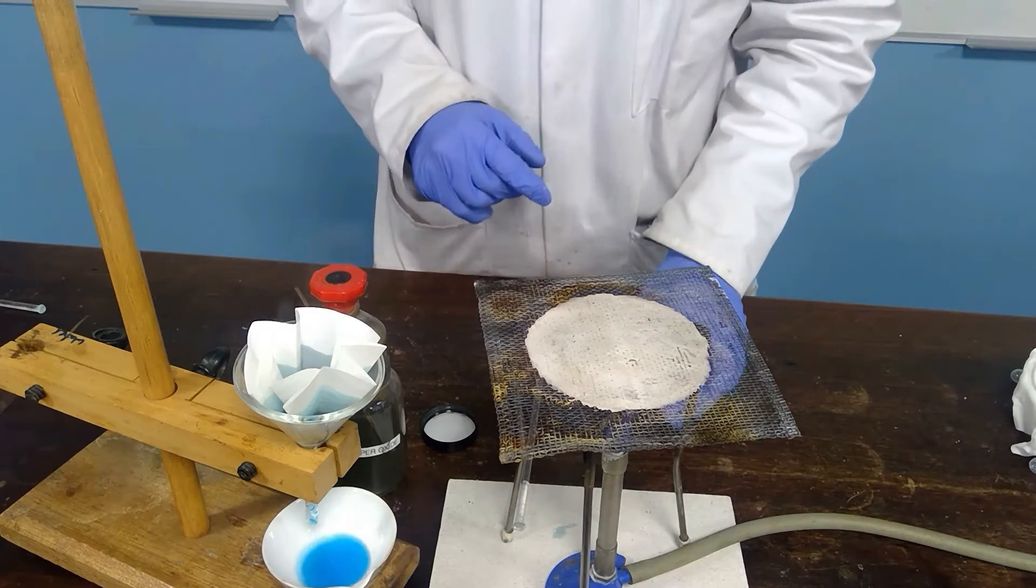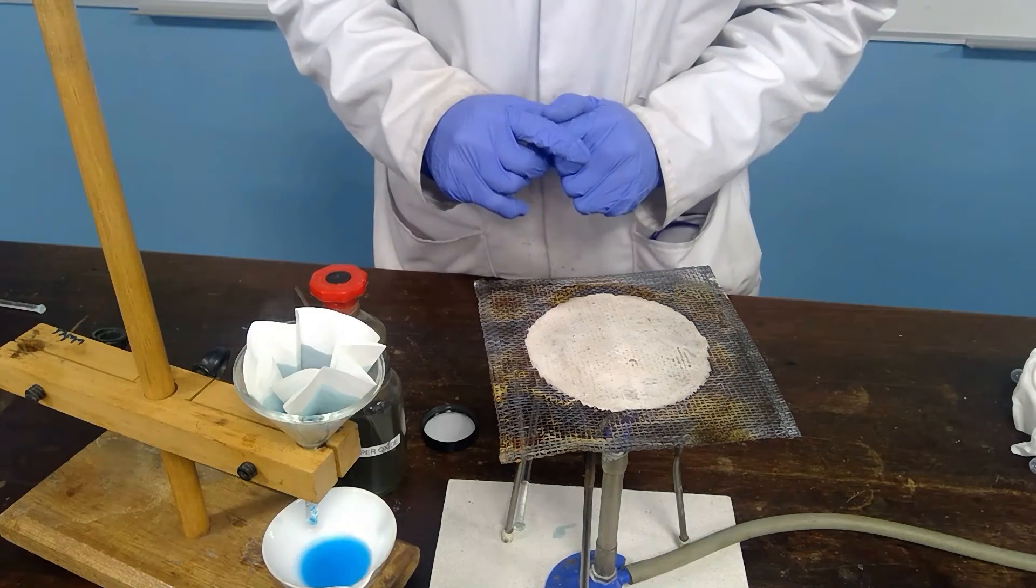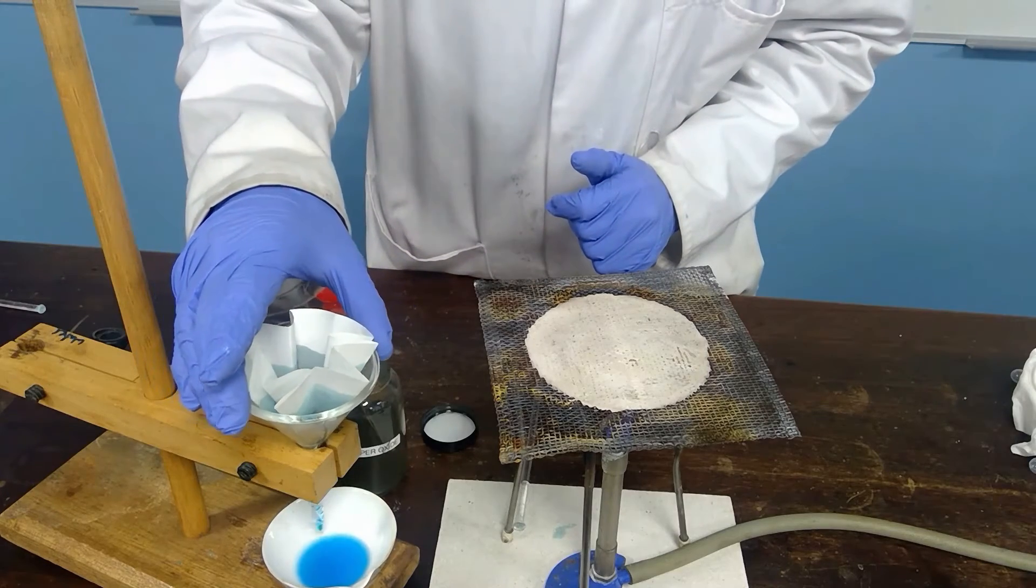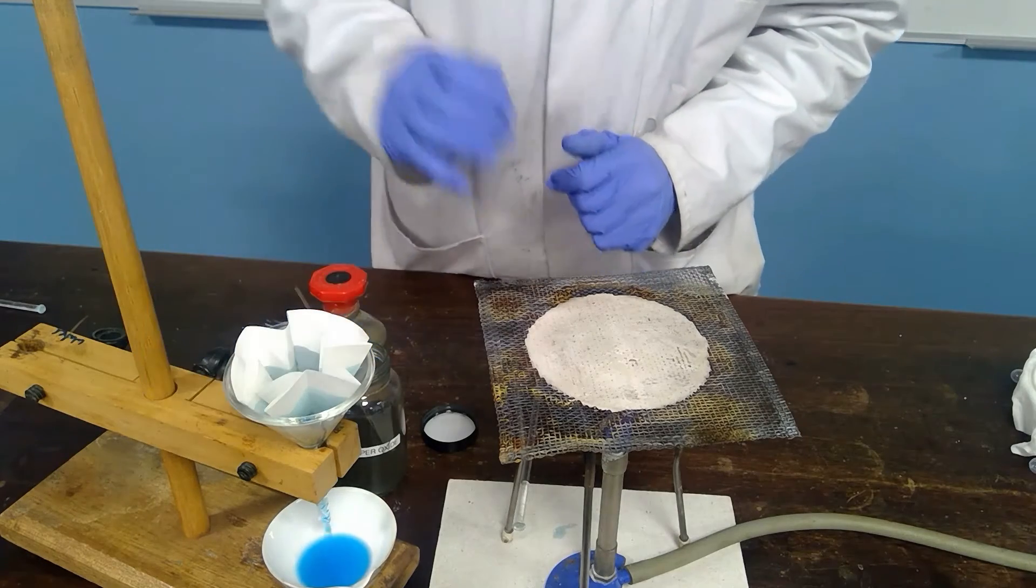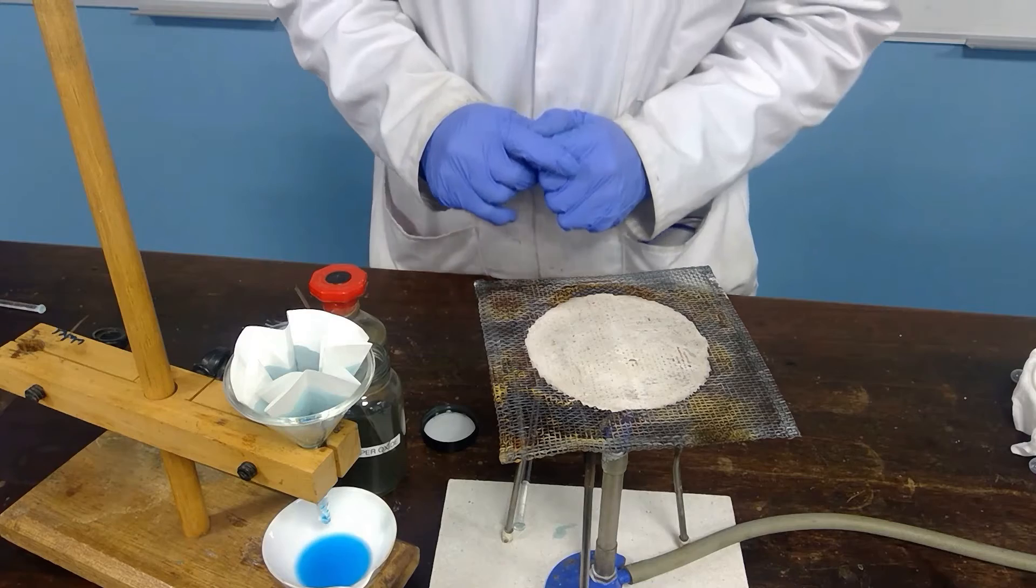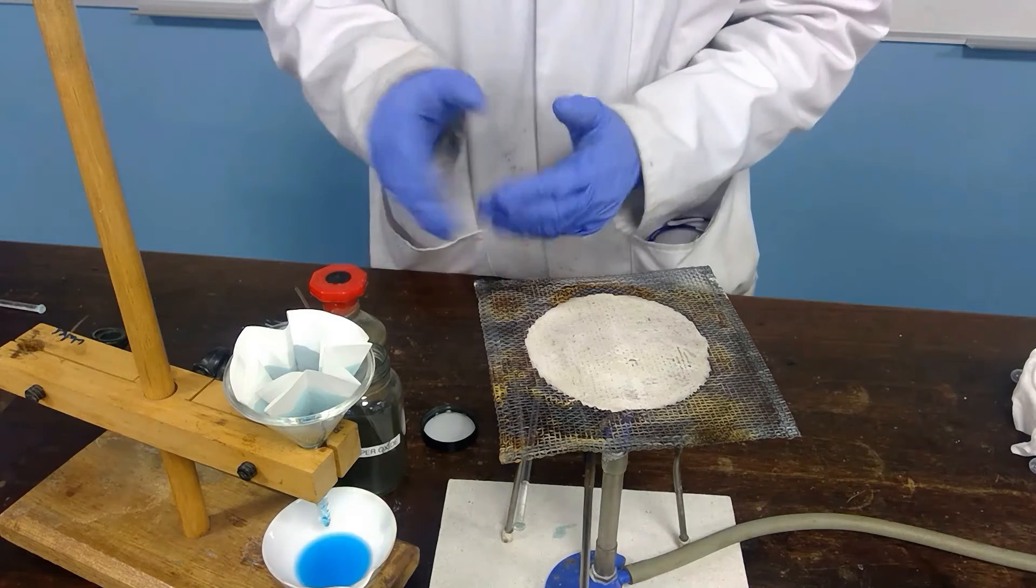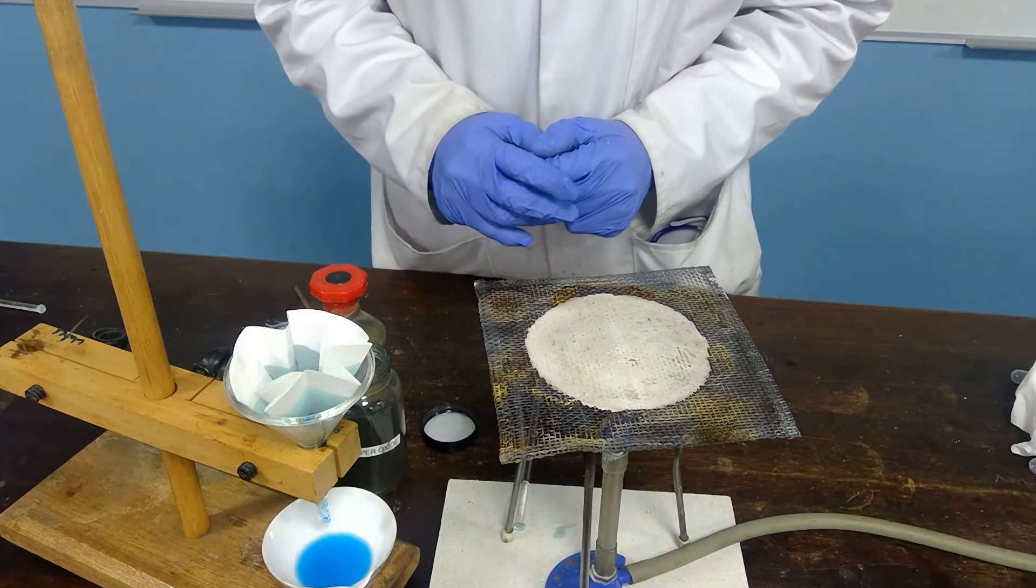Now, as we were saying earlier on, we only need to get some copper sulfate crystals. So at this stage, we don't need to wait for this filtration to complete. We can simply work with this quantity of the copper sulfate solution.